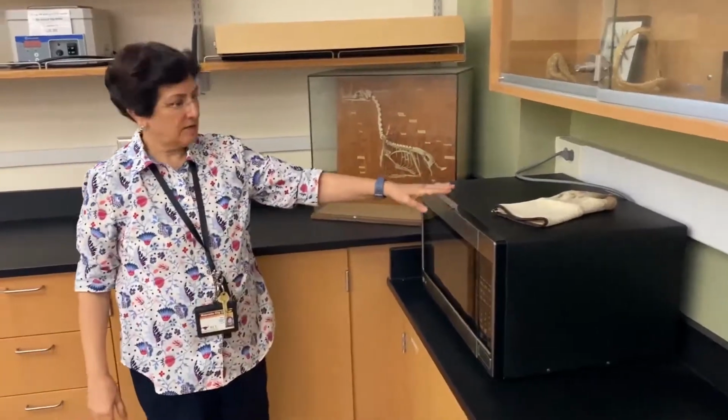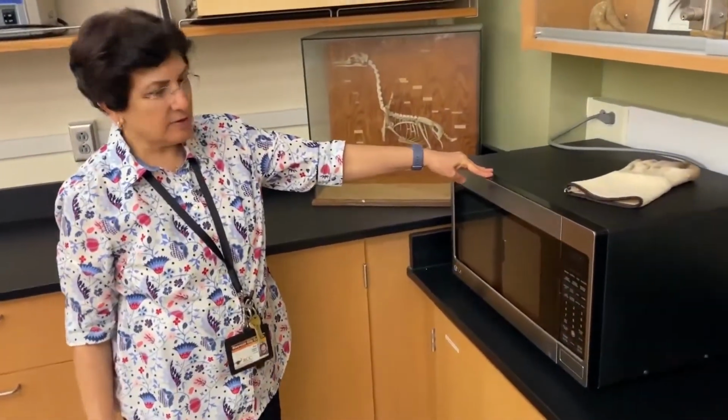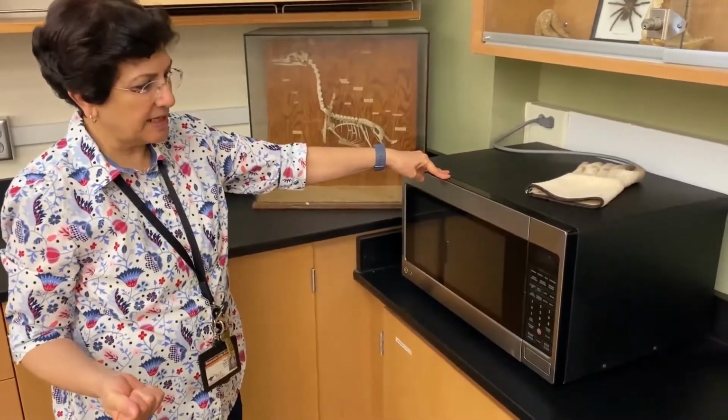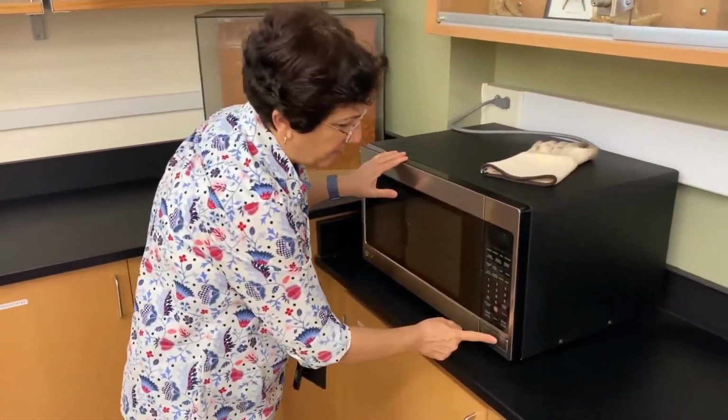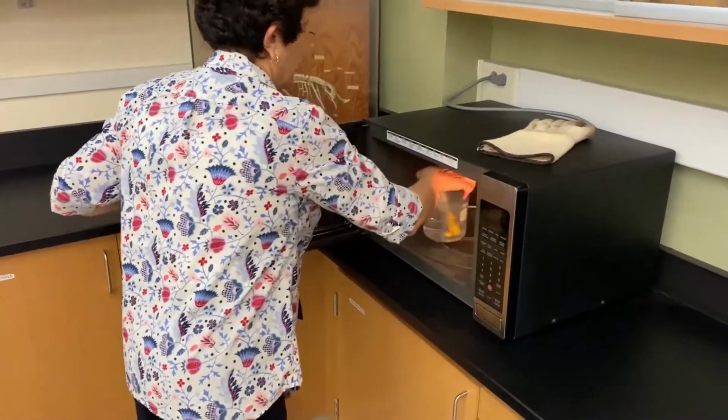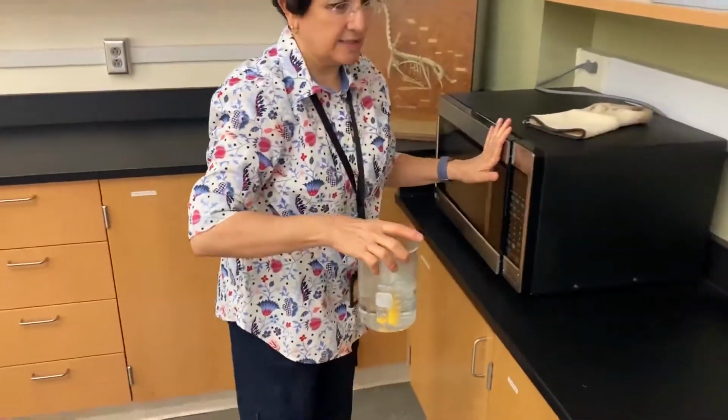Okay, guys, we put those tubes in the microwave in water, obviously, for about 1.5 minutes. And now we're going to take them out and go to our table and discuss the results.